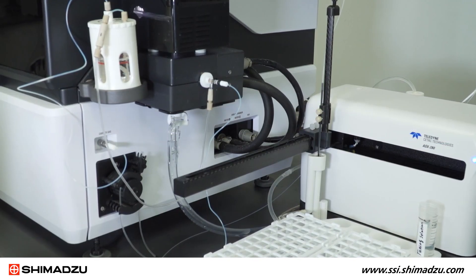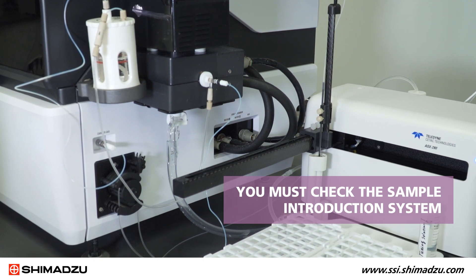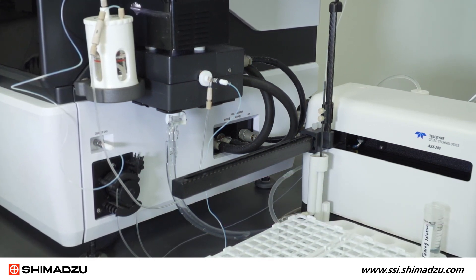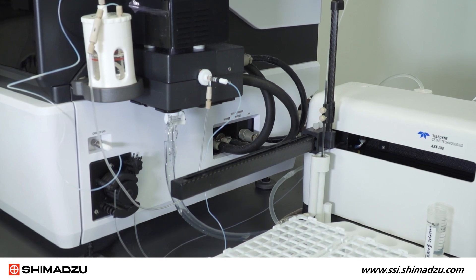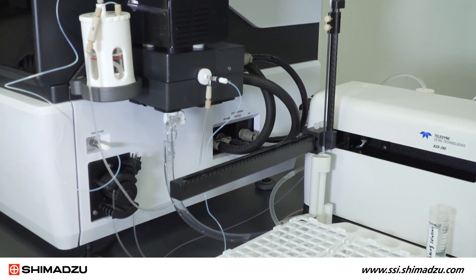If the air bubble doesn't move smoothly, you must check the sample introduction system, including the probe, sample tubing, peristaltic pump tubing, and the nebulizer to isolate the cause of the issue.